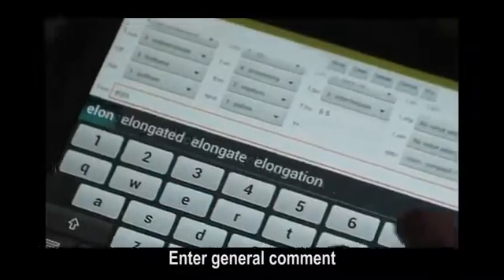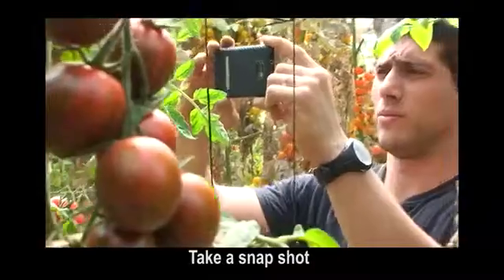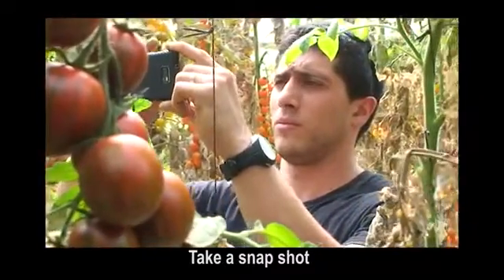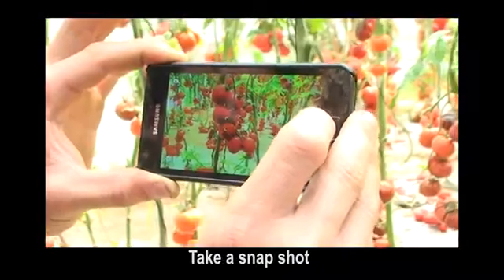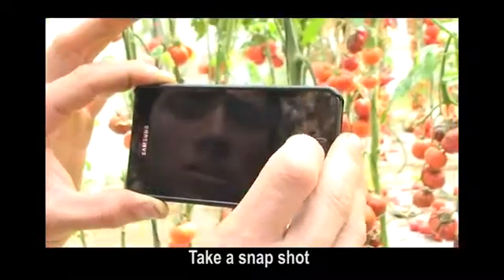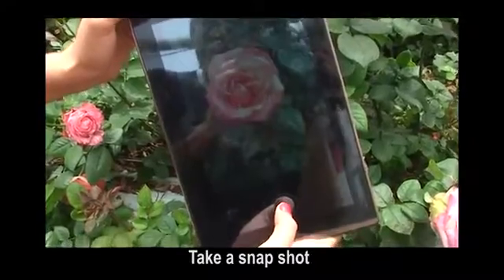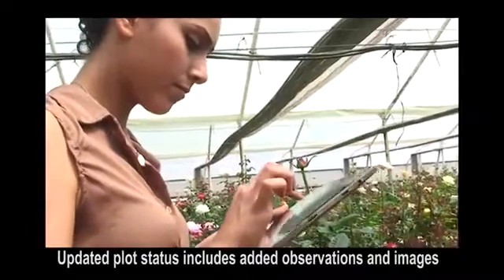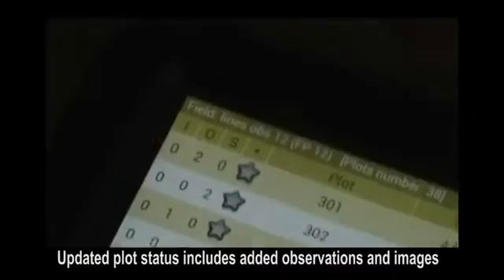Enter a general comment. Add one or more snapshots. Select done and the new observation is added to the plot's info.